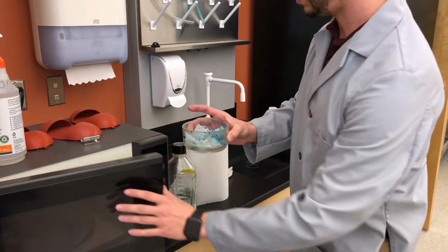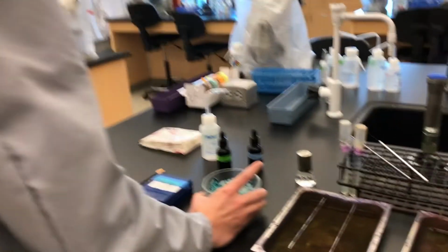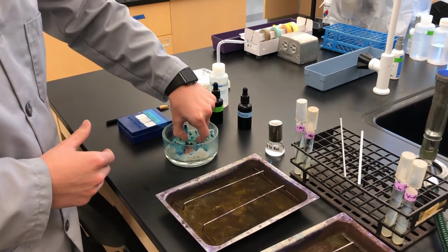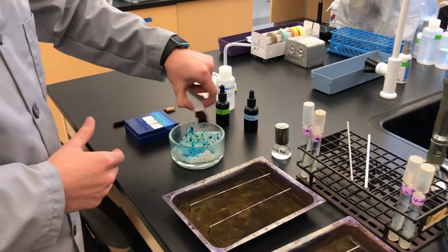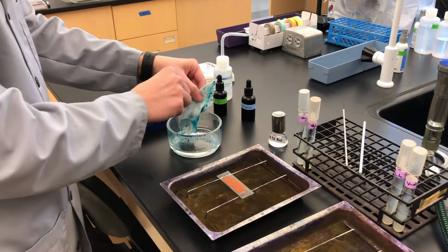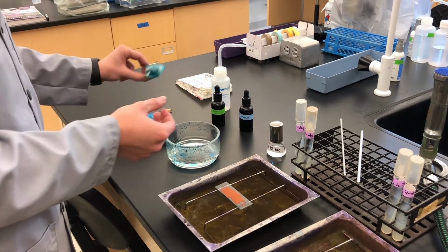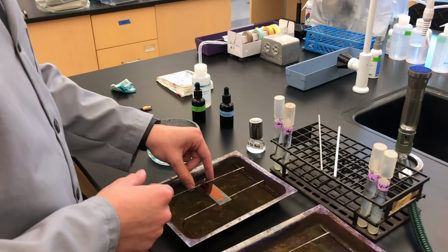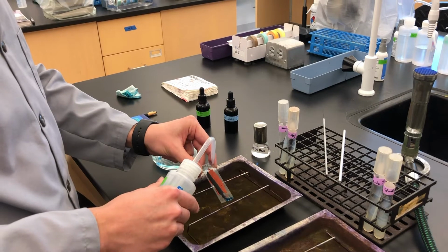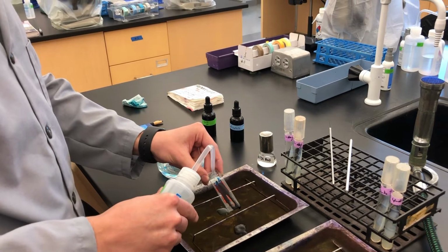All right, so now we have this lovely mess. Bring it back over here. And if you don't want to get your hands dyed, use gloves. Pull your slide out, set it down here, and remove your paper towel as waste so that then your lab partner or someone else waiting on one of these glass bowls can utilize it. Now take your slide, and we're simply going to wash malachite green off, just like you wash off any other dyes.